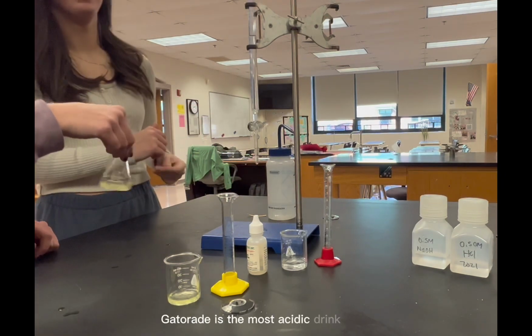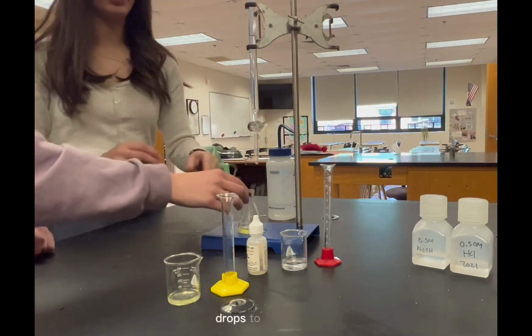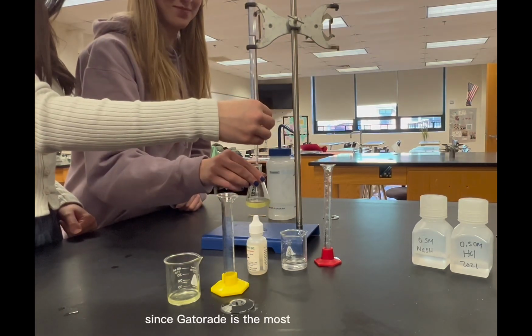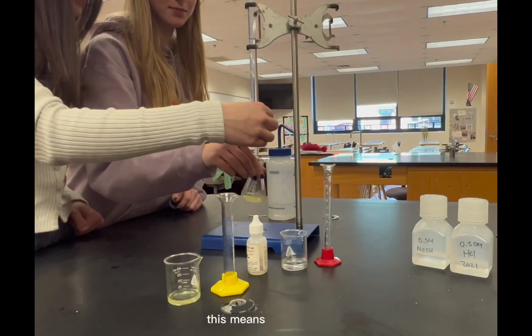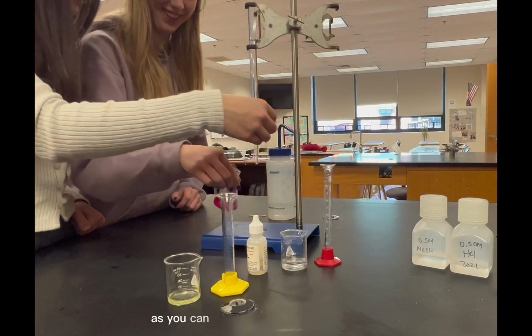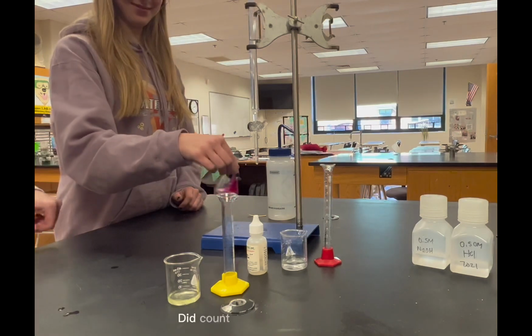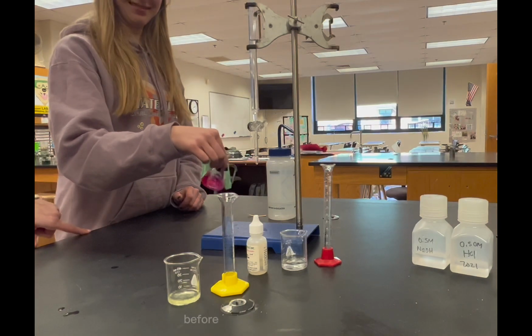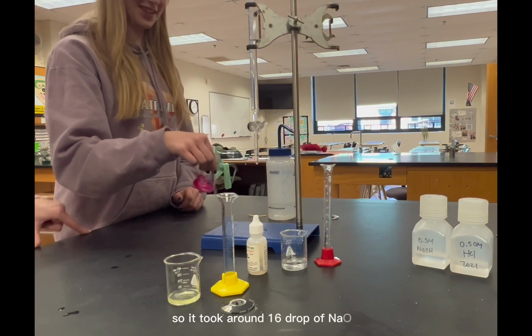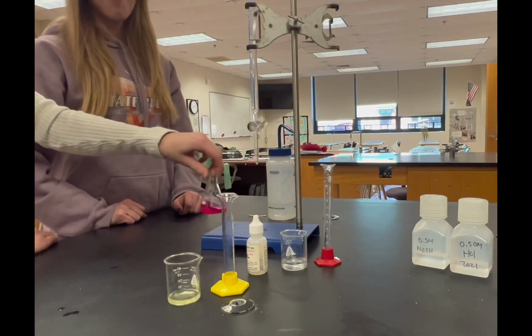Gatorade is the most acidic drink out of all. This means that it's supposed to take the most NaOH drops to neutralize. Since Gatorade is the most acidic drink out of all, this means that NaOH is going to dissolve very fast in this drink. As you can see, the solution is over-titrated. But indeed, Nina and Bella did count 16 drops of NaOH before it reaches over-titration, so it took around 16 drops of NaOH to neutralize Gatorade, meaning that it's the most acidic out of all.